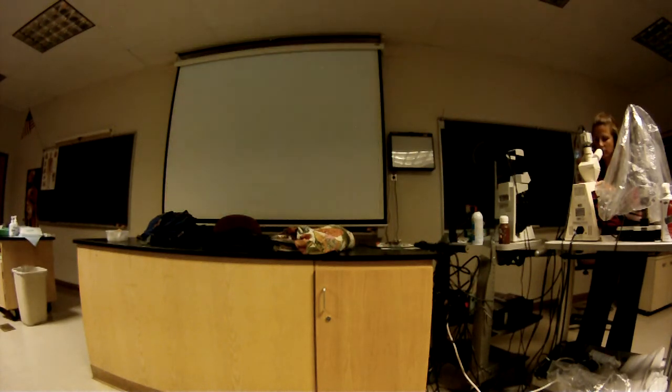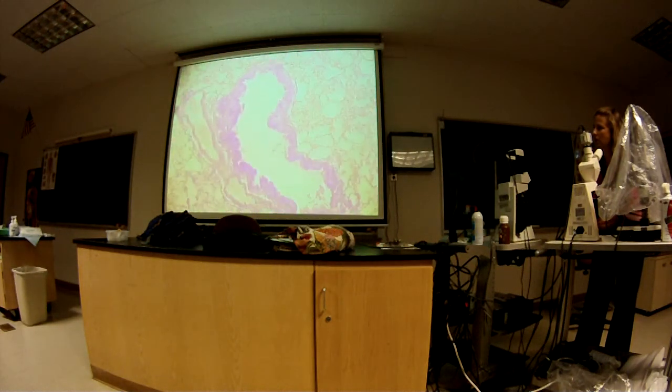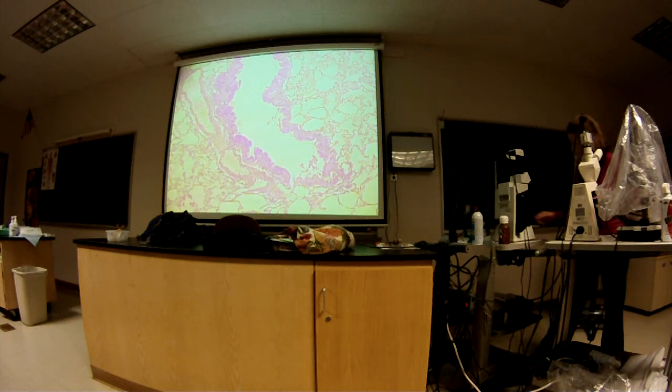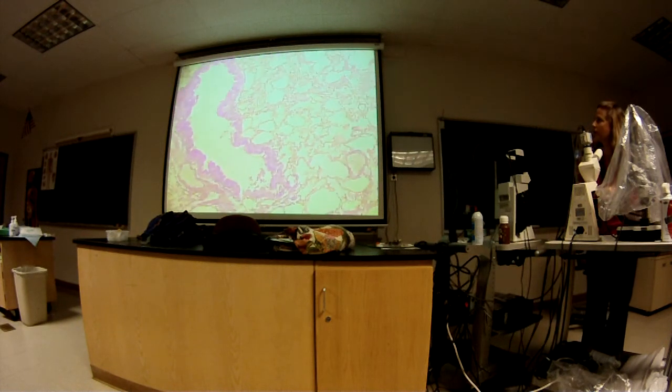Okay, so let's go back out one more time. Just take a look at it. So, bronchiole. And let's see, what else do we need? Okay, we go back for the lymphoid nodule and the alveoli. And then I think we've pretty much covered it.